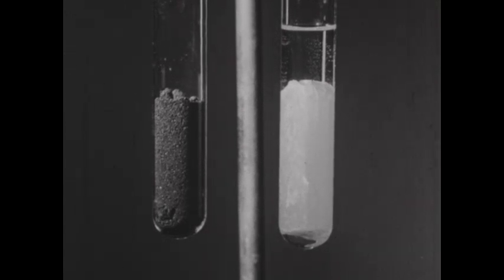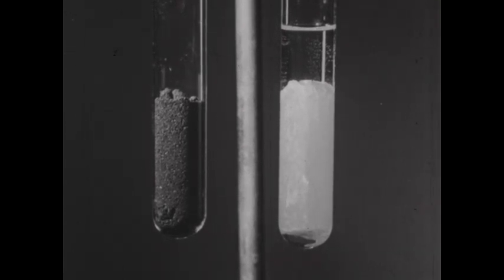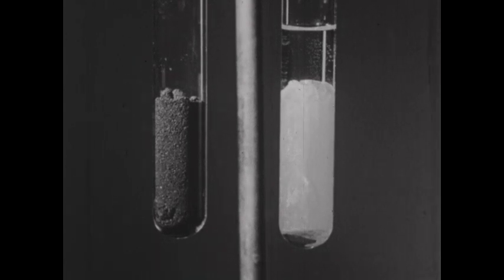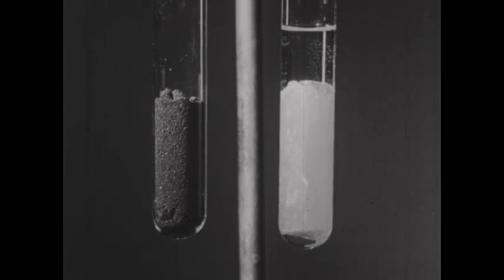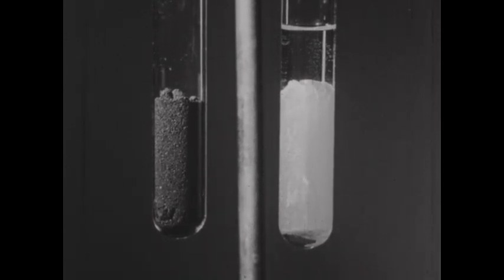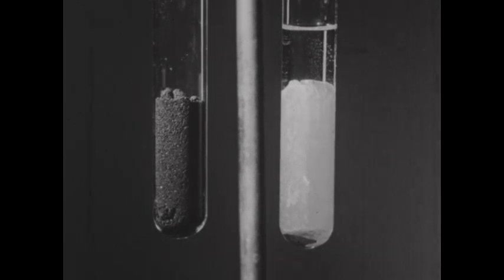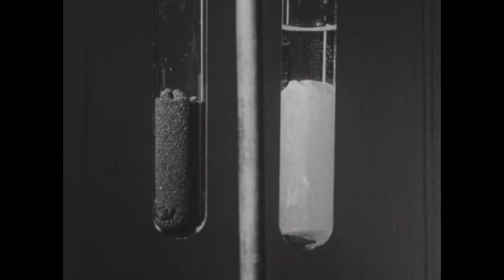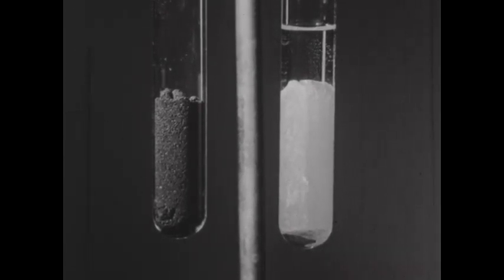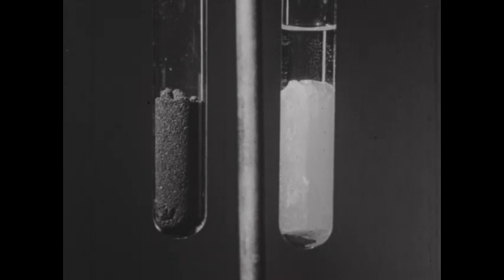White phosphorus is in the tube on the right. It's the form prepared by the condensation of phosphorus vapor, and when freshly prepared, is white. However, this form of the element is metastable and slowly turns to the red form.